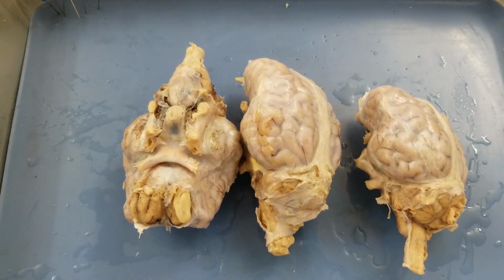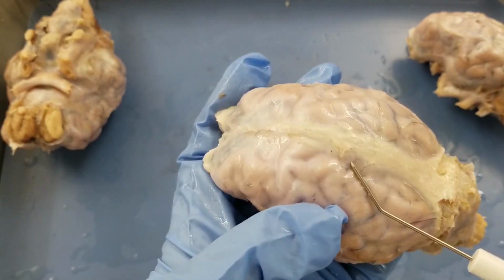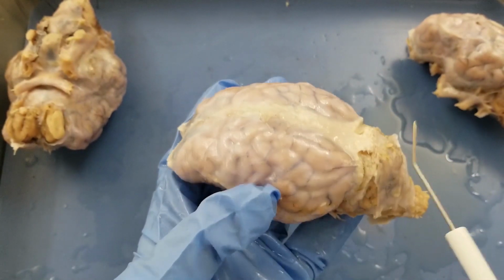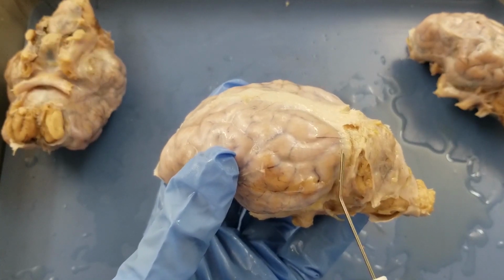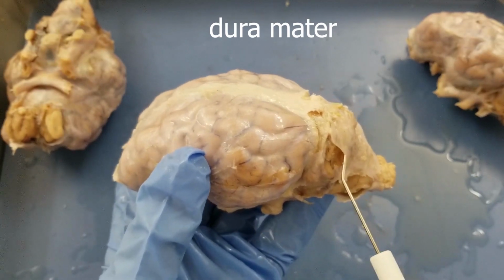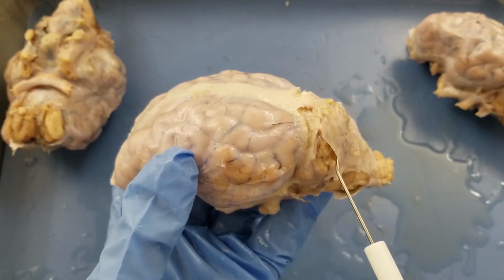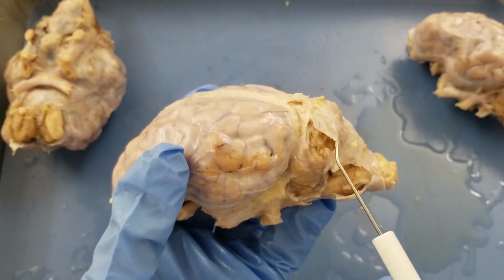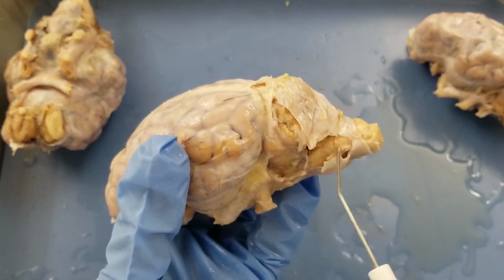So next, I need to peel out the meninges. You see this plastic-looking structure here, the membrane, that is the meninges. There are 3 layers of them, but we cannot see all 3 layers on the sheep brain. We can only see the tough one, the dura mater, right? So that's the dura mater. Underneath that, there is the arachnoid, and there's the pia. They're so thin that we can't even peel them off the brain, but they're there.